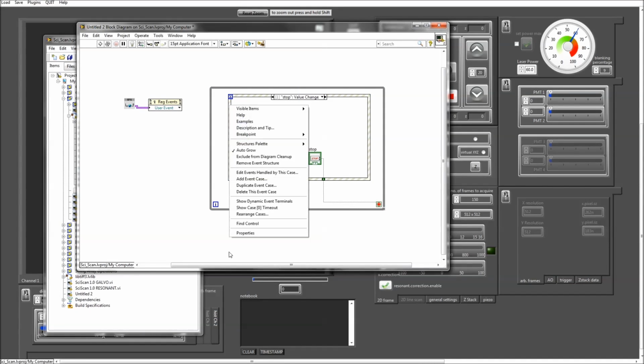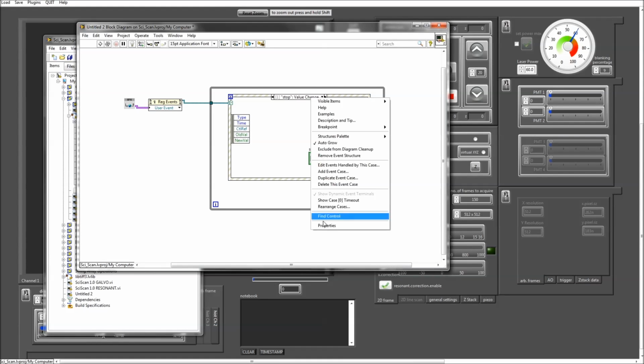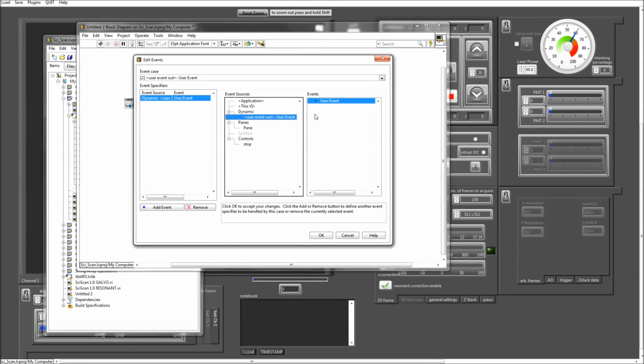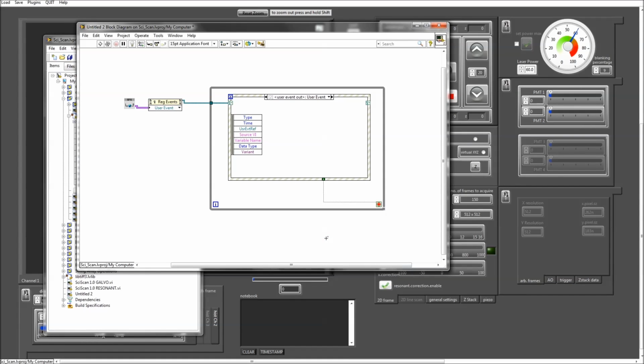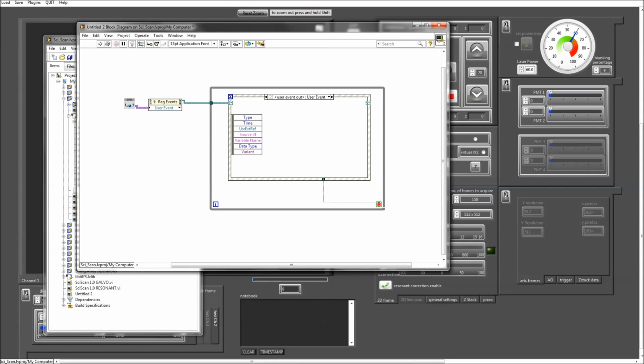But more importantly, I'm going to wire this event registration to my event structure here, and now I can add an event case that will listen for a user event. And in my case, a user event will be any variable change in the GFG. You can see here that it will tell me the source VI, so which VI has generated this change in the GFG. It will tell me which variable has been changed. It will tell me the data type of that variable, and obviously the data itself stored in this variant data type. So I can now listen for specific variables that I'm interested in.